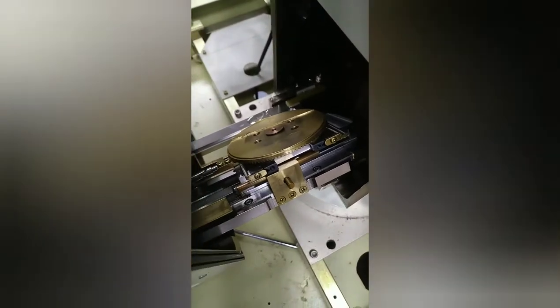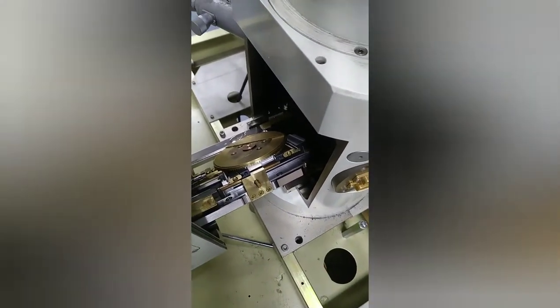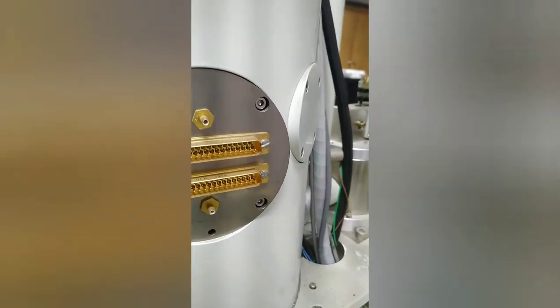So I got it open — it just has two lock screws that retain it. You can see the markings from not knowing that. Seems like most of the stage stuff works pretty well, all feels very smooth. I have X, Y, Z, R, and T axes. Not really sure why they're labeled like that, but I don't really care. You can kind of see inside of here. I'm not sure what the thing on the side is adjusting — maybe moving the aperture or something. There's definitely a lot of optical stuff in there, or charge optics, whatever it's called. And then I found out this is just a feed-through, so I guess if you need to look at something under power, this has a lot more features than I anticipated.